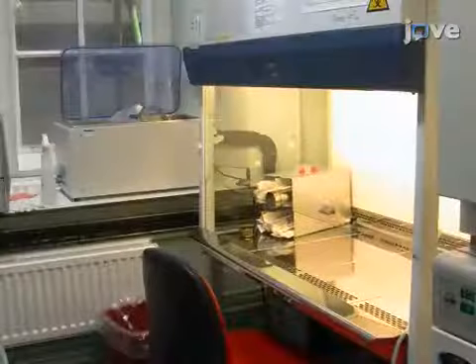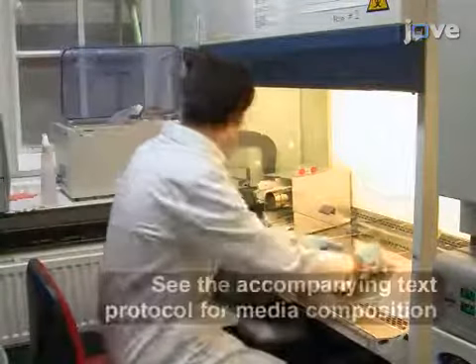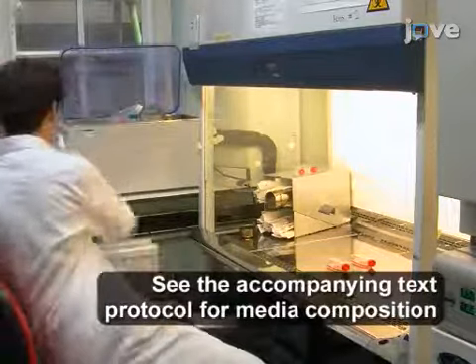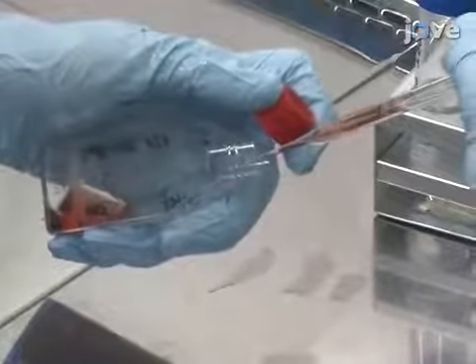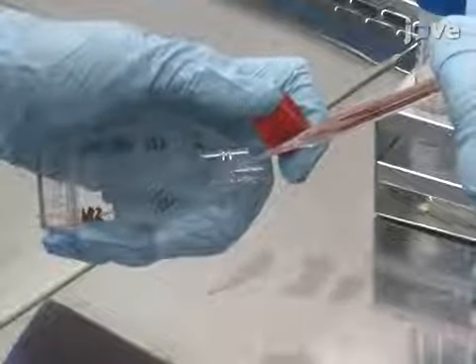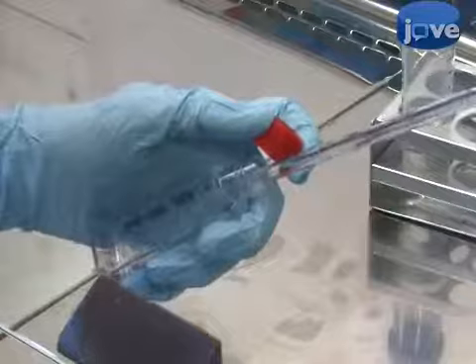Prior to aggregation, maintain mouse embryonic stem cells, or mESCs, in ES-LIF medium on gelatin-coated 25 square centimeter tissue culture-treated flasks. For aggregate generation, start with a tissue culture flask containing cells at 40 to 60% confluence. Aspirate the medium and rinse the flask twice with PBS.